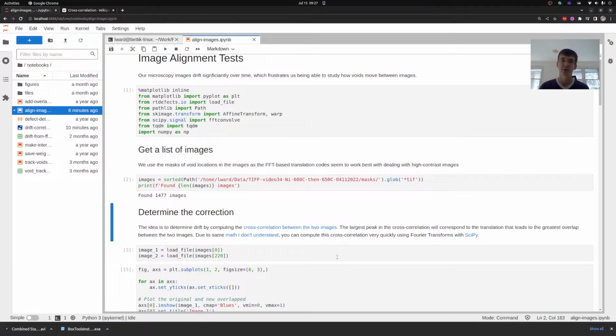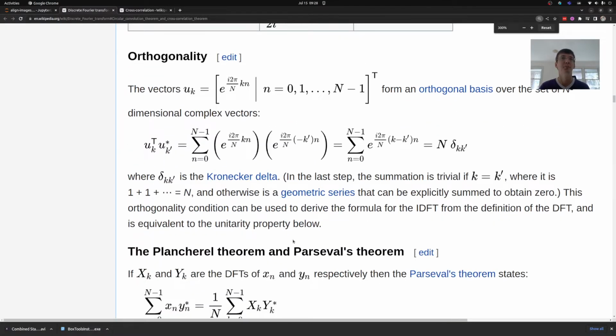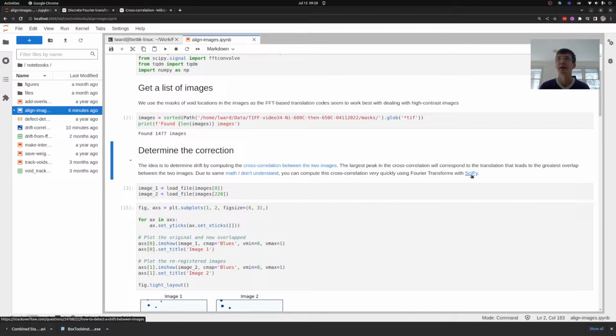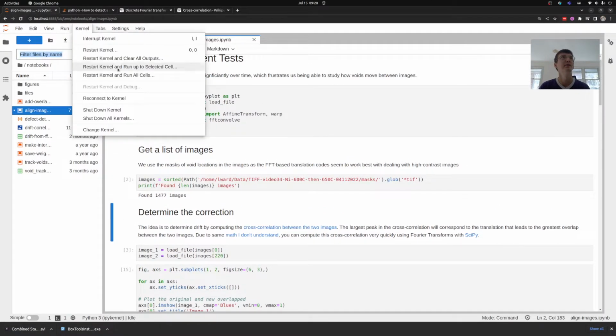The problem at first is that computing this with images can be slow, especially when we use high resolution microscopy images that each have 1 million pixels. So what we're going to do is use a technique based on Fourier transforms. I cannot explain the math to you, I'm sorry, but what we can see from this theorem down here is that I can compute a cross correlation between two images using a Fourier transform so long as I reverse the second image. Fourier transforms are actually very quick to compute thanks to some other clever mathematics I don't know, and thanks to Stack Overflow you can find quickly how to compute them using SciPy's fast Fourier transform convolution operation. So let's go and do a quick demo of how that works.